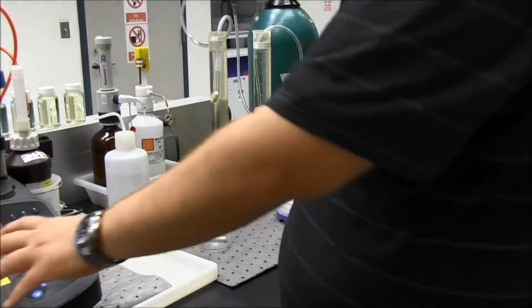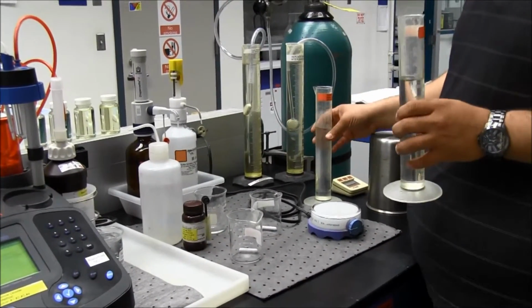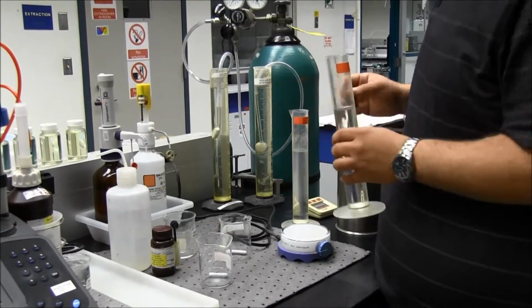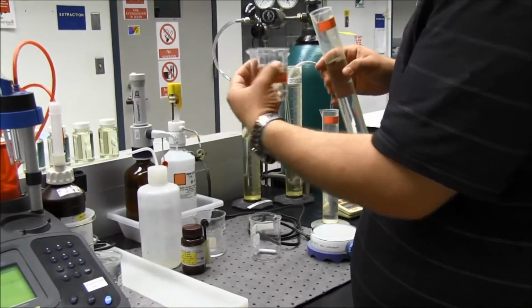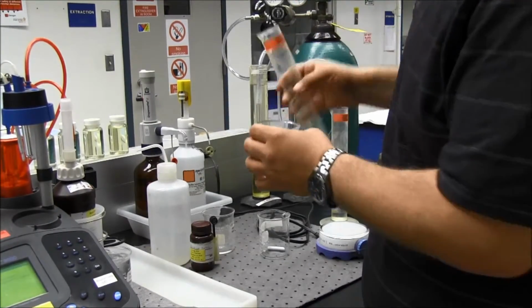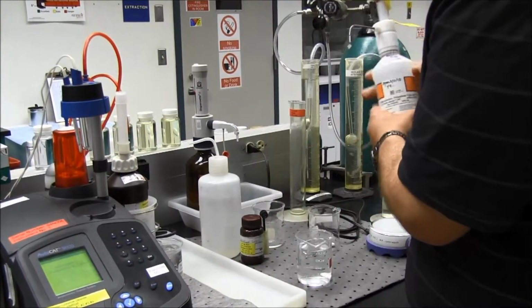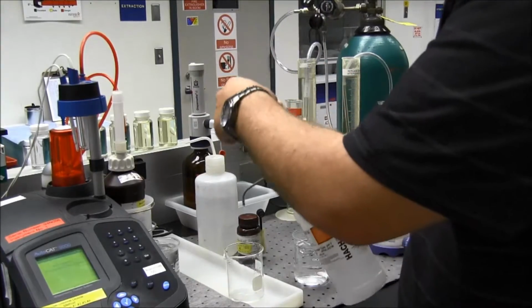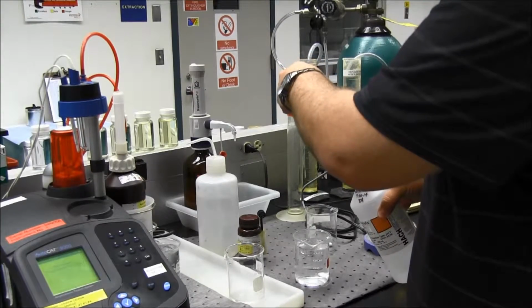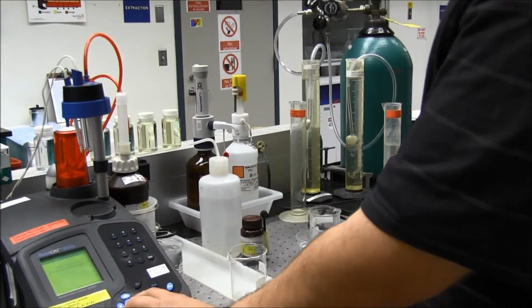The first step says add reagent number 1, phosphate buffer, 1 dose. This test is a 4-part titration, which will require 400 milliliters of water. So I'll take my first 200 milliliters and pour it into my sample container that has been triple rinsed. It says add phosphate buffer, 1 dose. So this is my phosphate buffer solution. This is key too: you want to make sure that you purge this so you don't have any air, and that you're getting a solid sample of the dose. So I'll put that in, and I'll hit the check mark for OK.